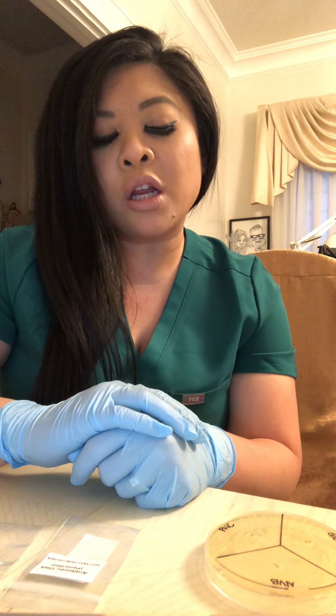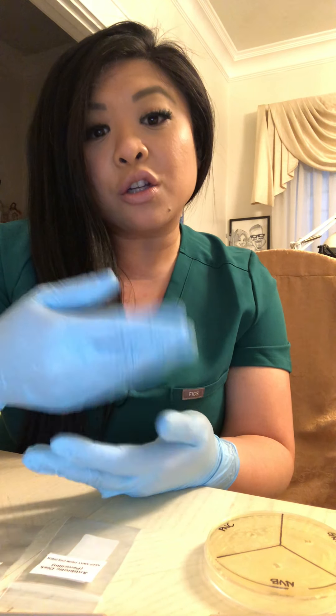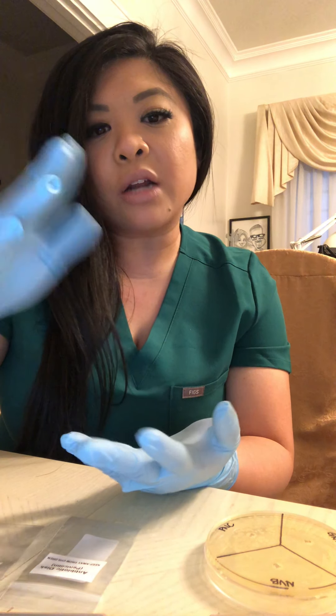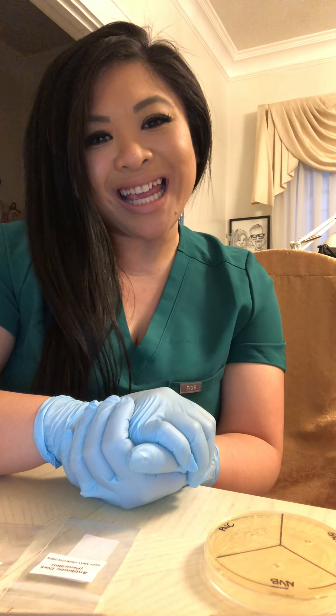Just an overview: although I was disappointed that my S. epidermidis bacteria did not grow as expected, it was still quite interesting to explore on my own and to figure out what my results could have been if I had a much newer culture. Additionally, it was interesting to learn about this popular antibiotic, see it under the microscope, and research its benefits. That concludes my video for Week 7. Thank you.